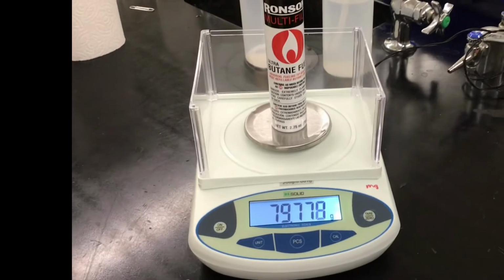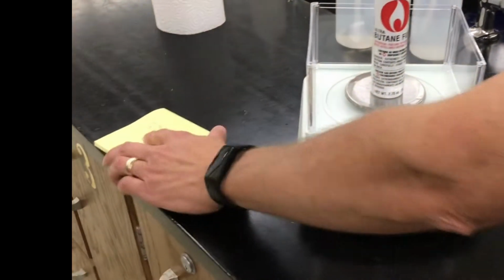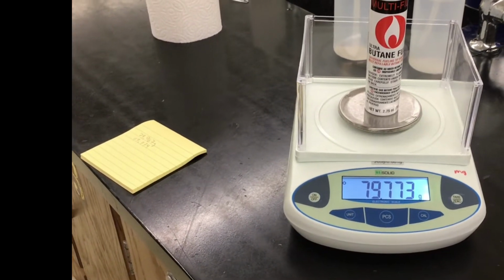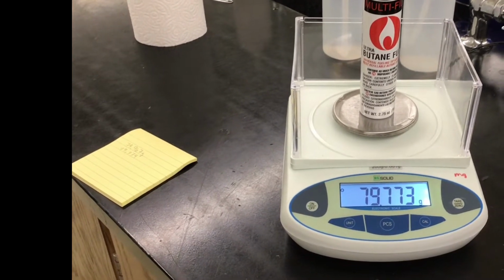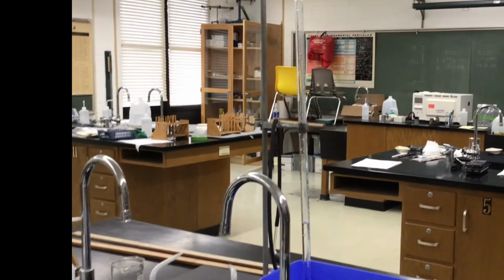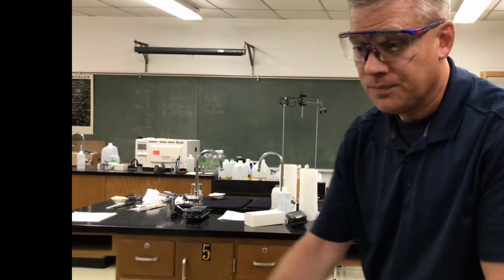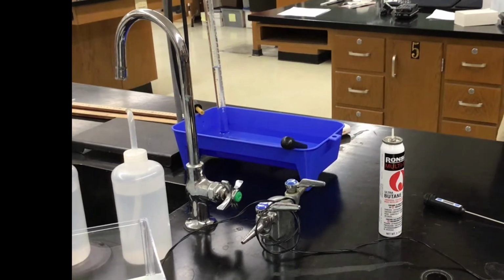So let's find the mass of this. Somebody want to calculate real quick. 79.774. Someone with a calculator subtract those real quick. It's 773 because of the motion of the balance. This is a good balance to the milligram. 0.193, that should be okay. 0.193 grams. That's how much mass of butane. That's very small. If I use the other balance, it'd be 0.19. I'm using 0.193 to have more accuracy. Okay, so I'm going to take that off. In a moment, we're going to read the volume, temperature, and pressure, and then do some calculations.